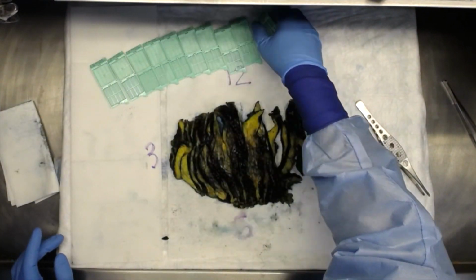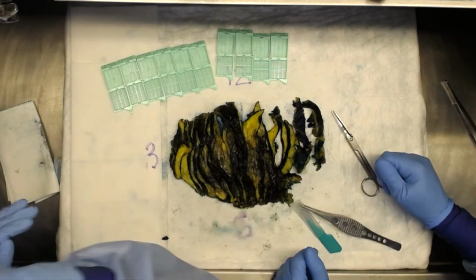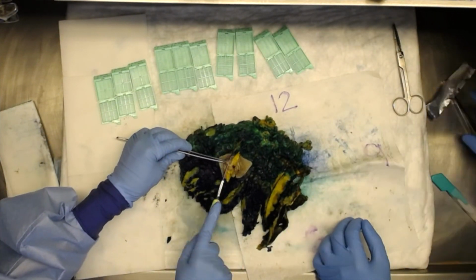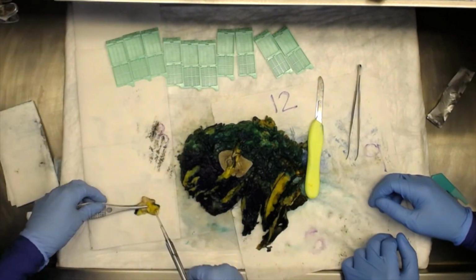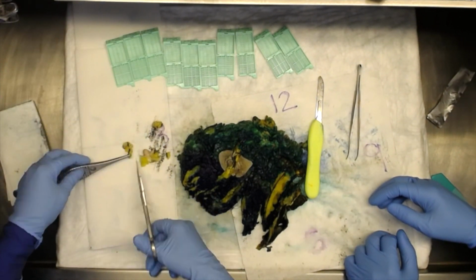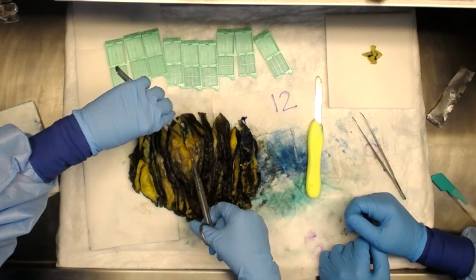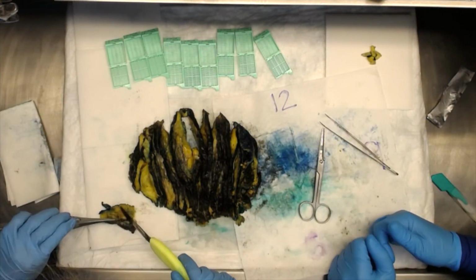Once all lesions are identified, you can begin submitting sections for histology. Submit 1 section of skin and 1 section of nipple. Trim the tissue as needed to make it an appropriate size for the cassette. Submit 2 to 4 sections of each lesion and representative sections of the margins closest to each lesion.